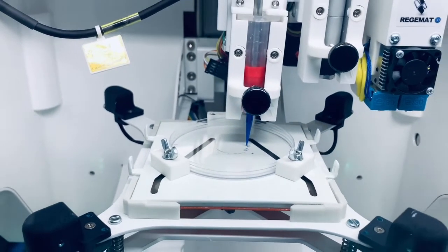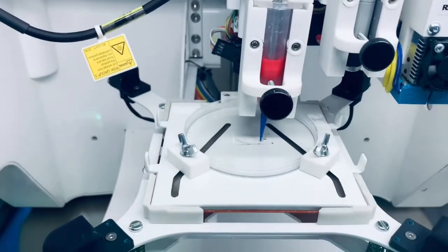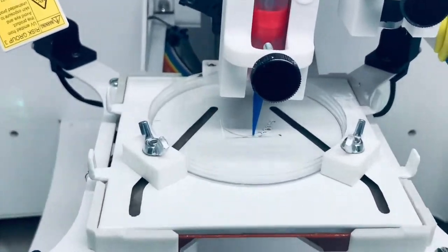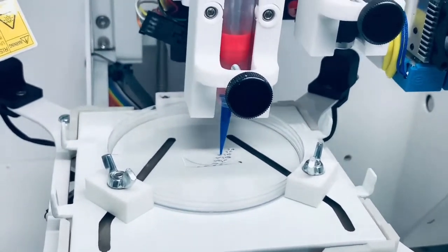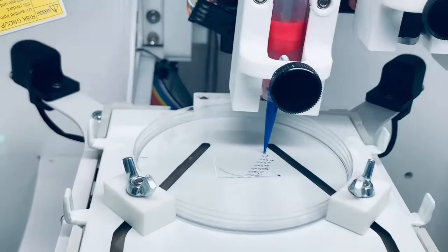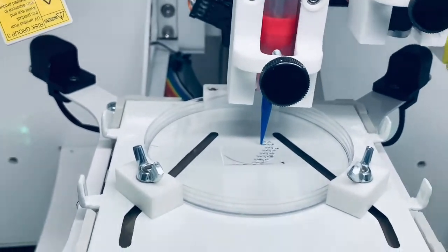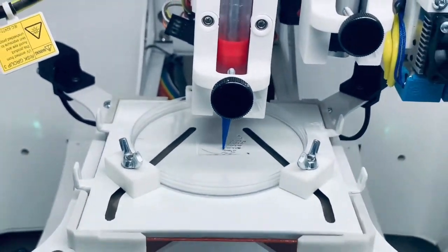In this case, we are bioprinting a wonderful honeycomb structure with a gelatin-methacrylate bioink and 2% of alginate, which is particularly useful for bone healing or cardiac regeneration patches.